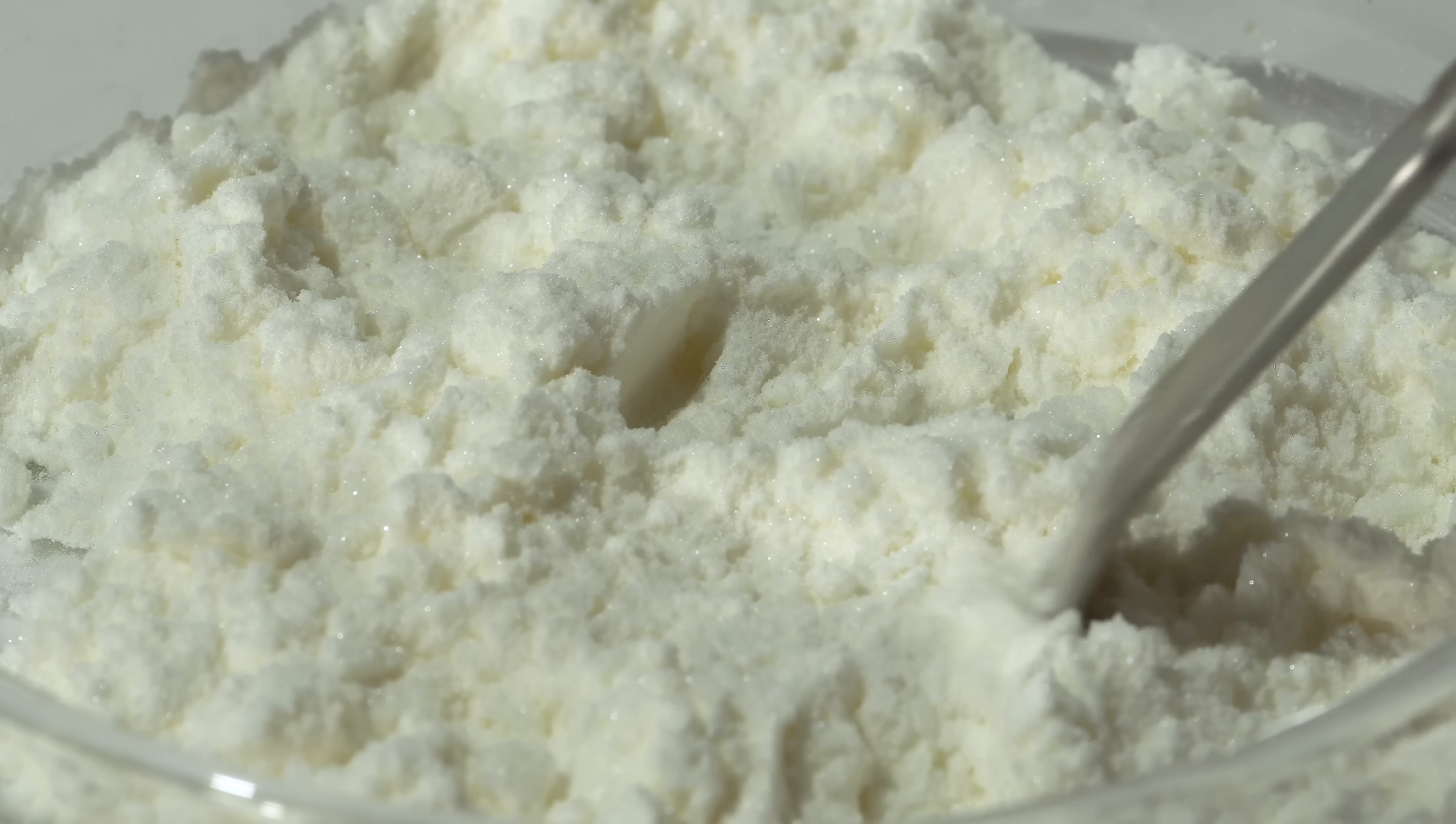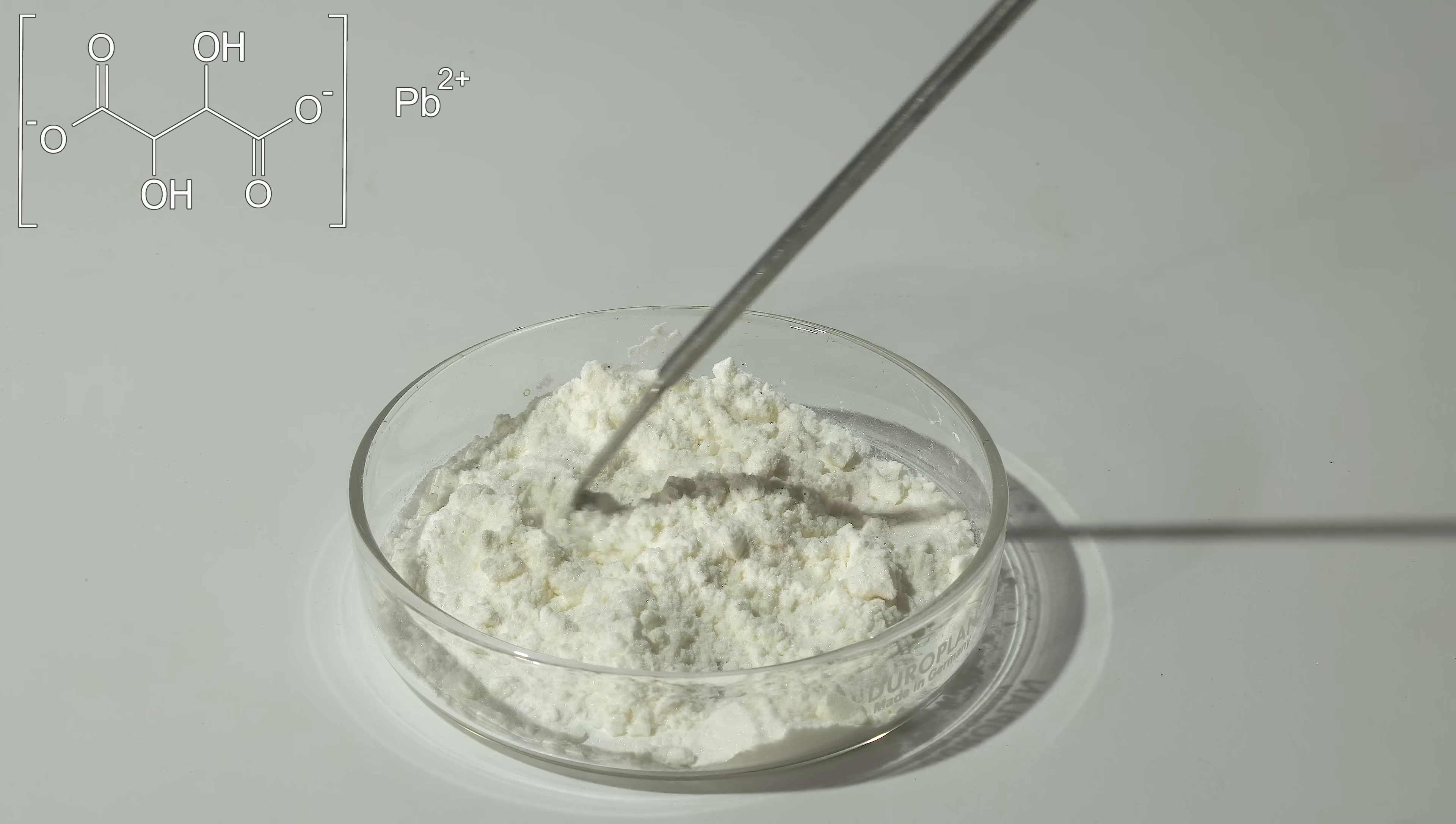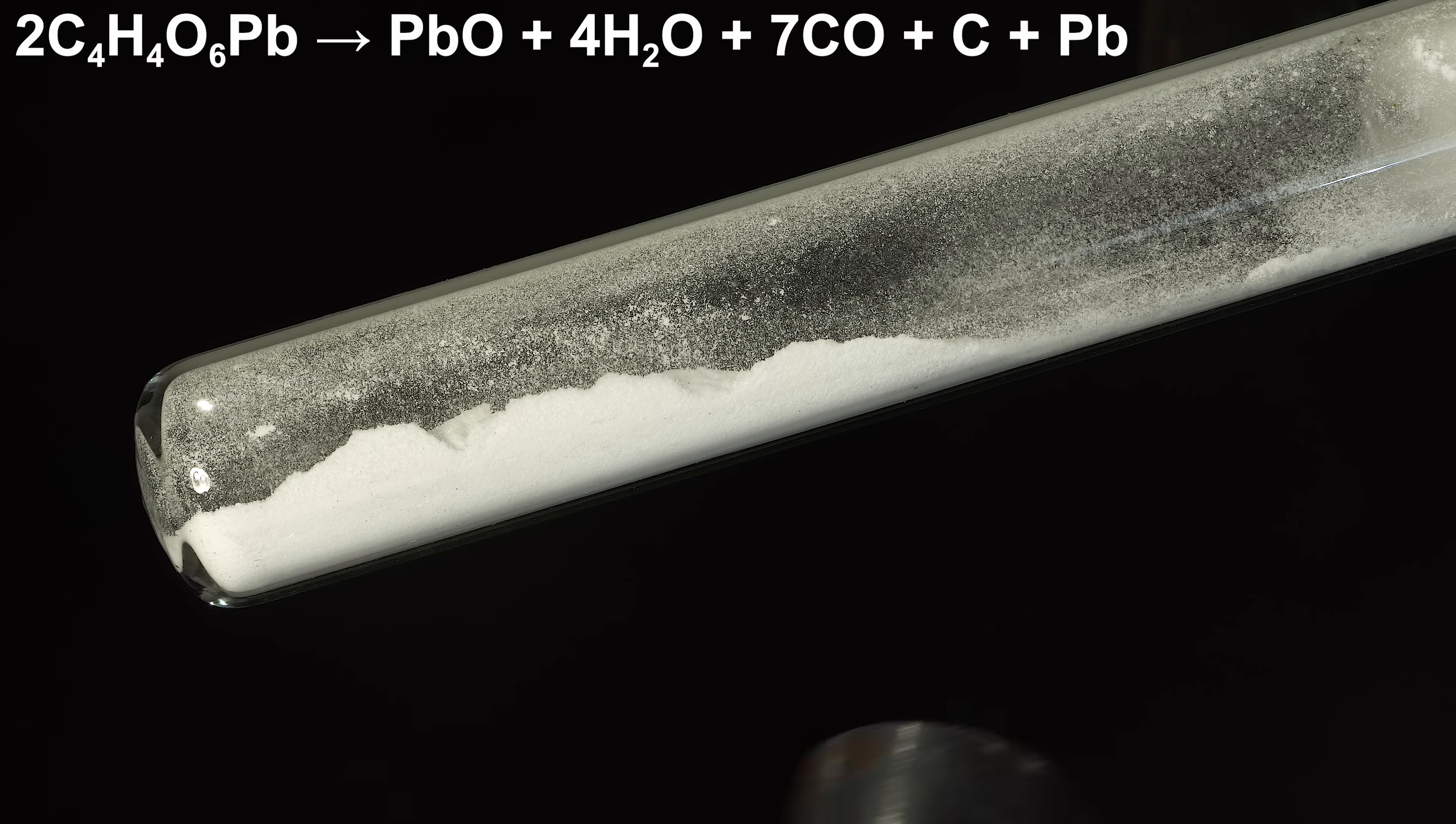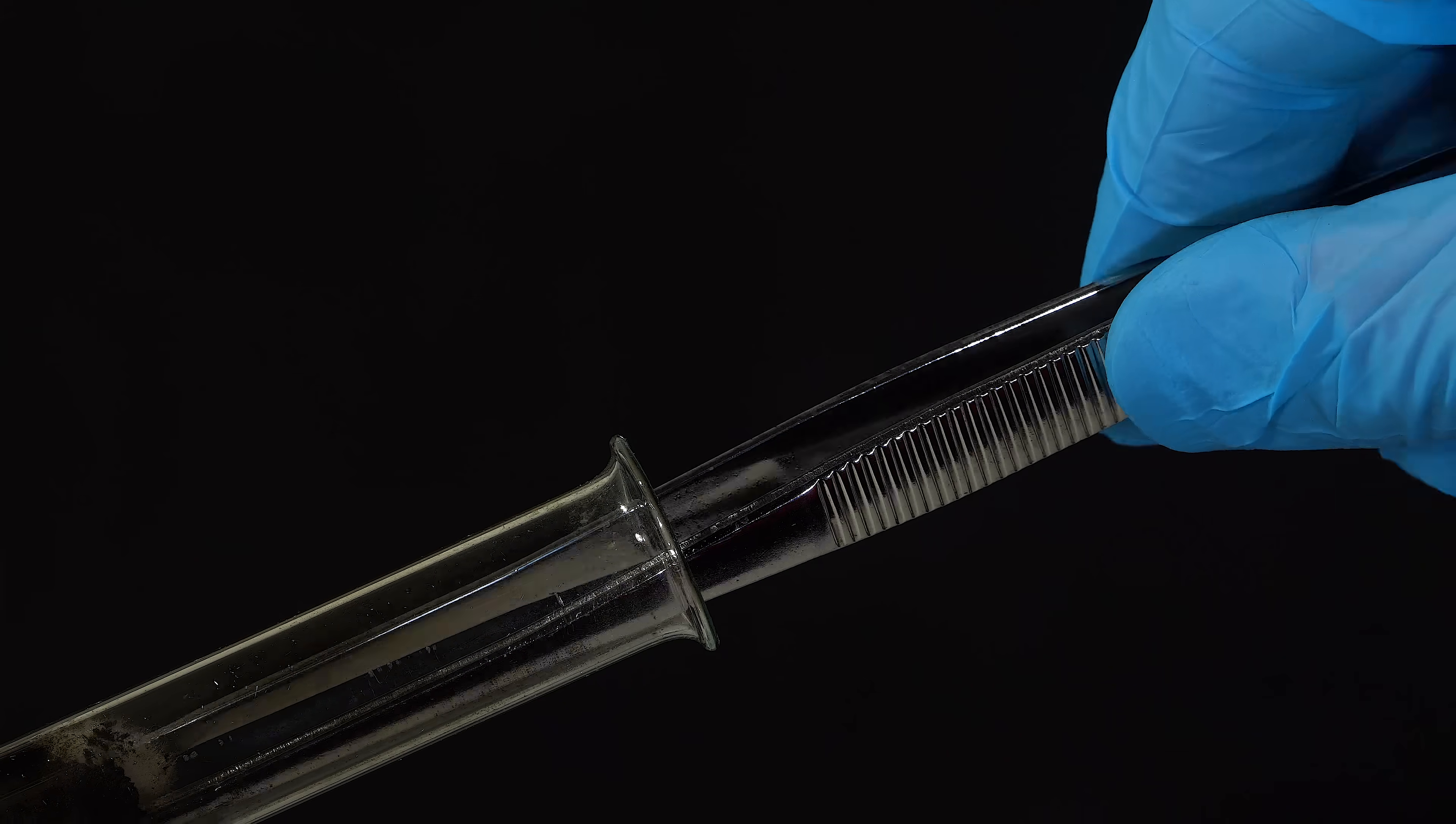This white powder has one interesting property. If you heat it in a test tube sealed with cotton wool to restrict air access, lead tartrate will decompose into lead monoxide, water, carbon monoxide, and elemental lead in the form of nano powder that readily ignites upon exposure to air.